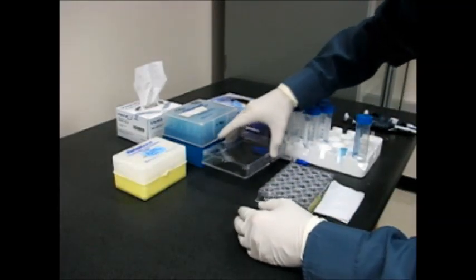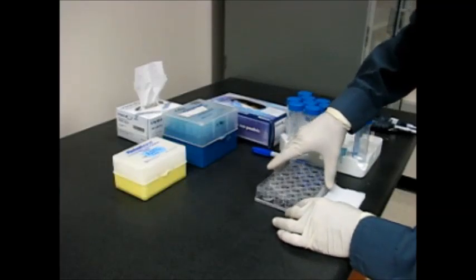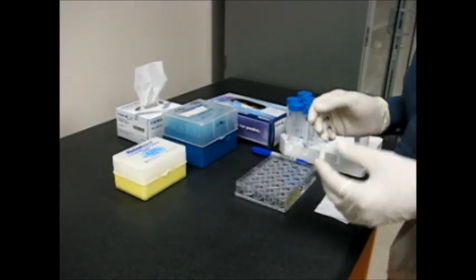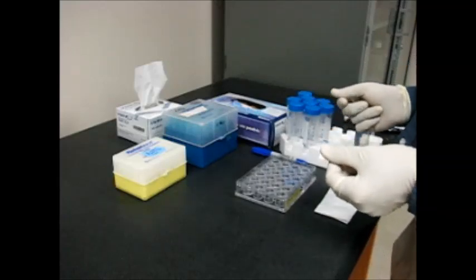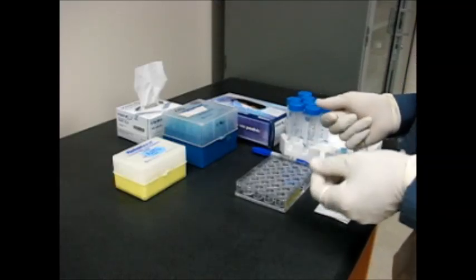Now transfer the lid on top to make sure it is well protected. This demonstrates how to set up a hanging drop vapor diffusion protein crystallization.